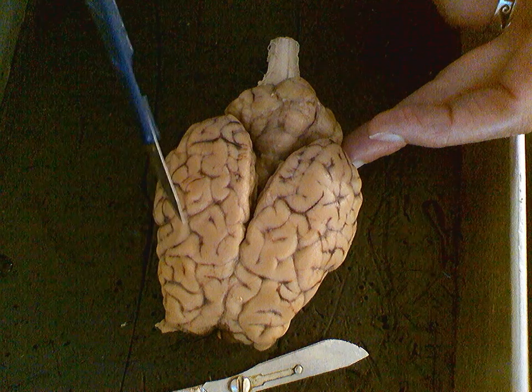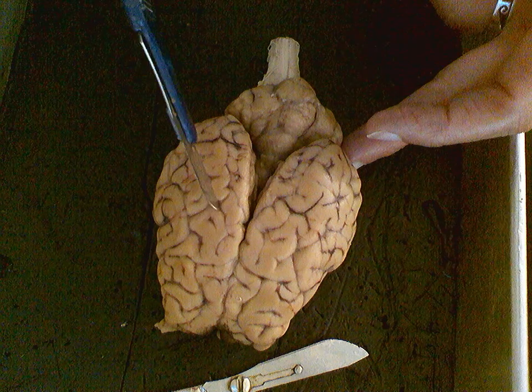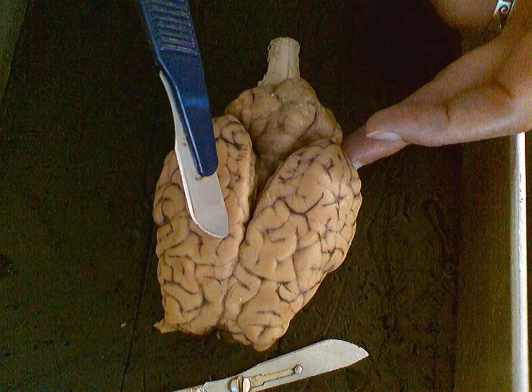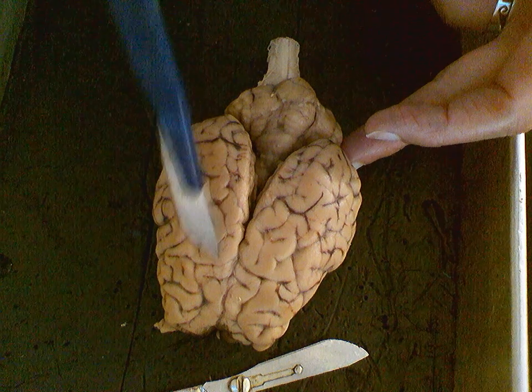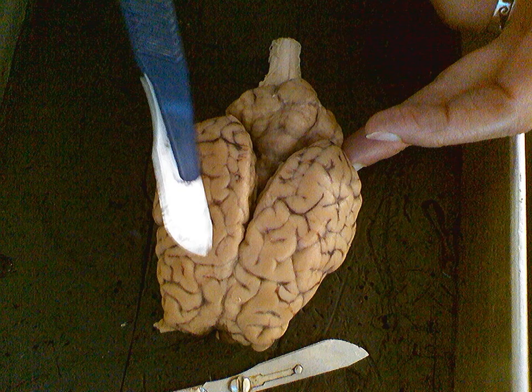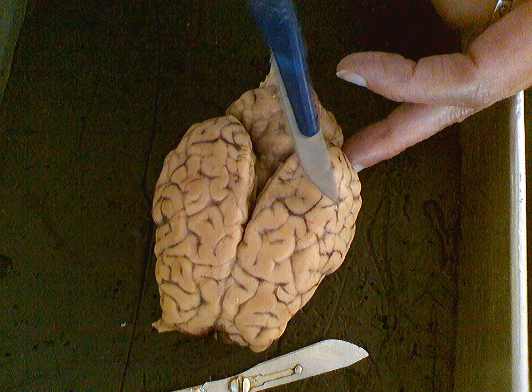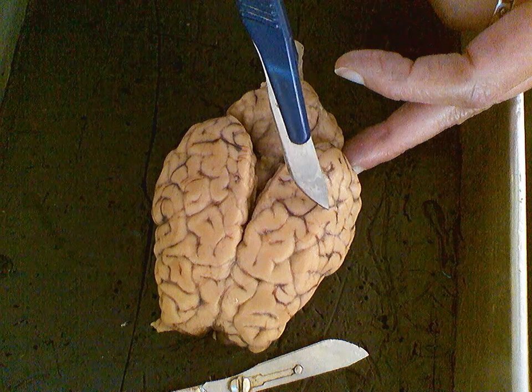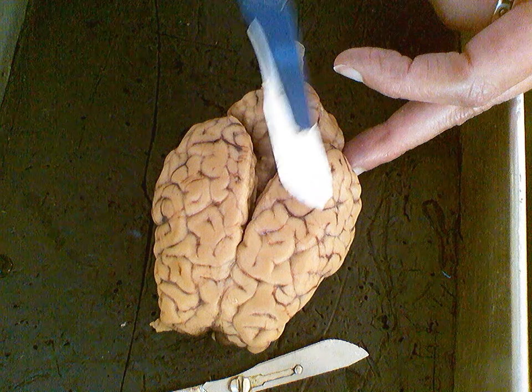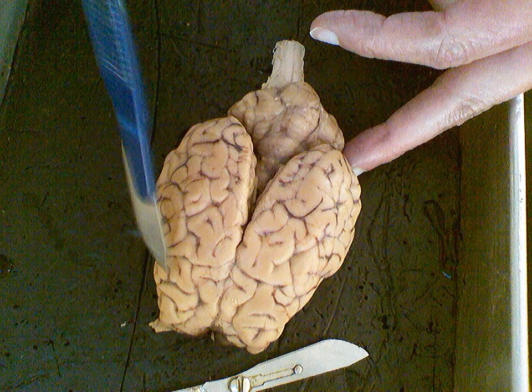We know that the brain has a coating on the outside of it, 3 layers, one that's very delicate, that contacts directly the surface of the brain, which is the pia mater. There is a web-like structure that has blood vessels running through it right above that. And so there are probably a few blood vessels in here, which are the arachnoid layer. And then finally, something that we cannot see here, but is a hard, real tough outer coating, the dura mater. And together, the pia mater from the inside, the arachnoid layer, and the dura mater on the outside form the structure we know of as the meninges. So the meninges coats and surrounds all of the brain and the spinal cord, so it protects it and it nourishes it.